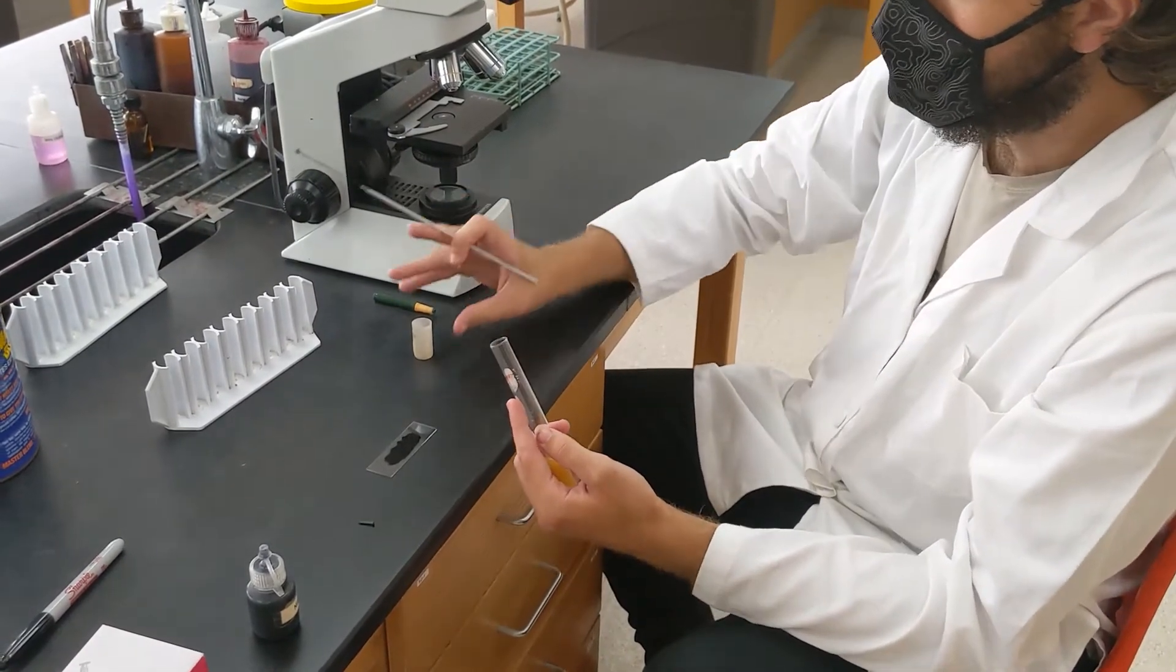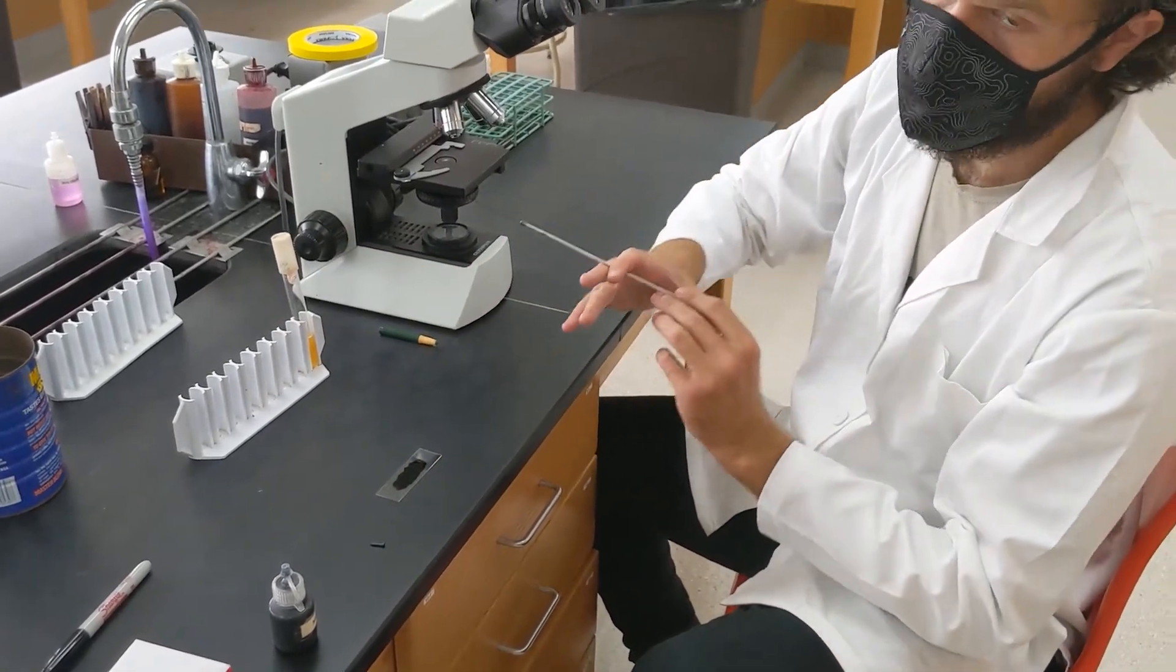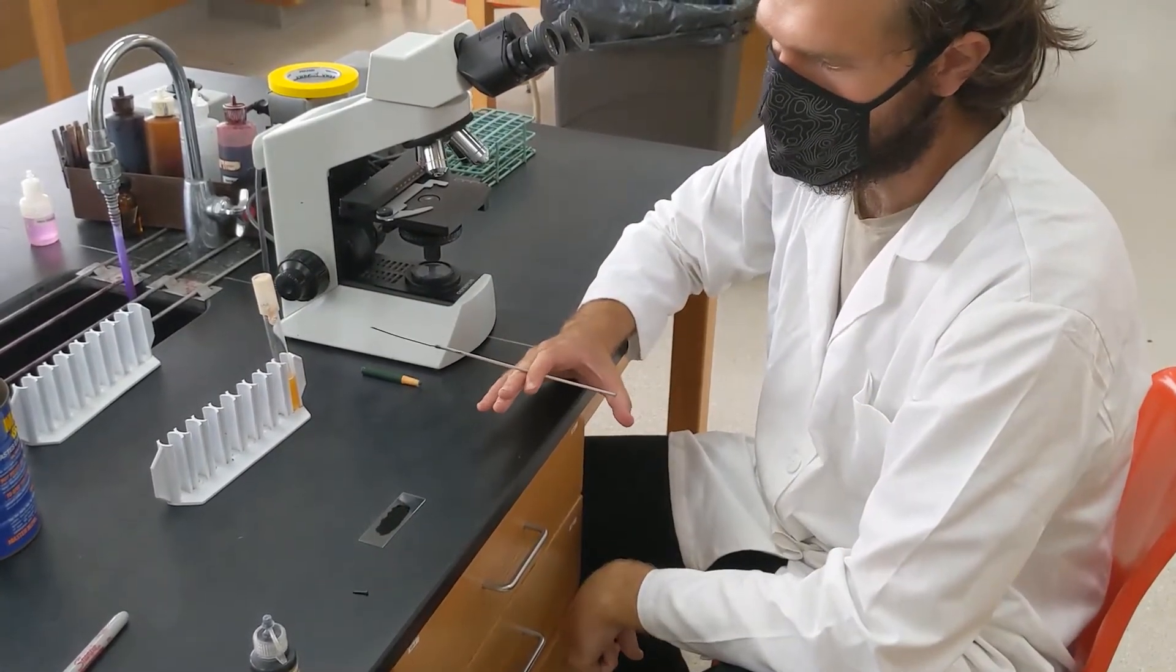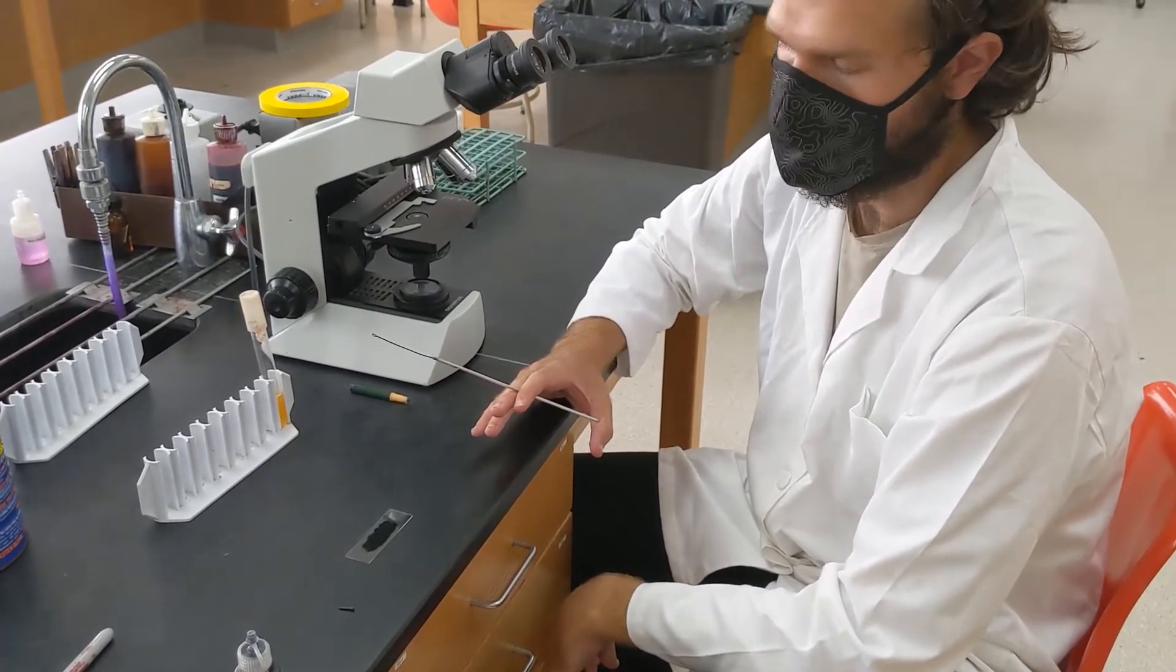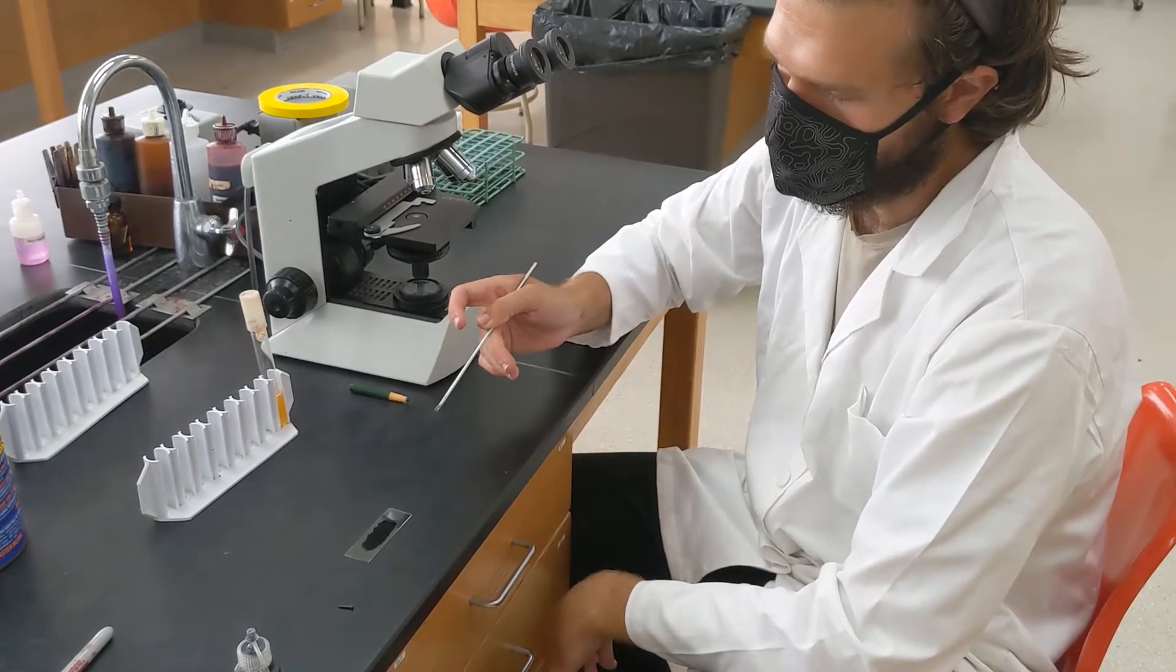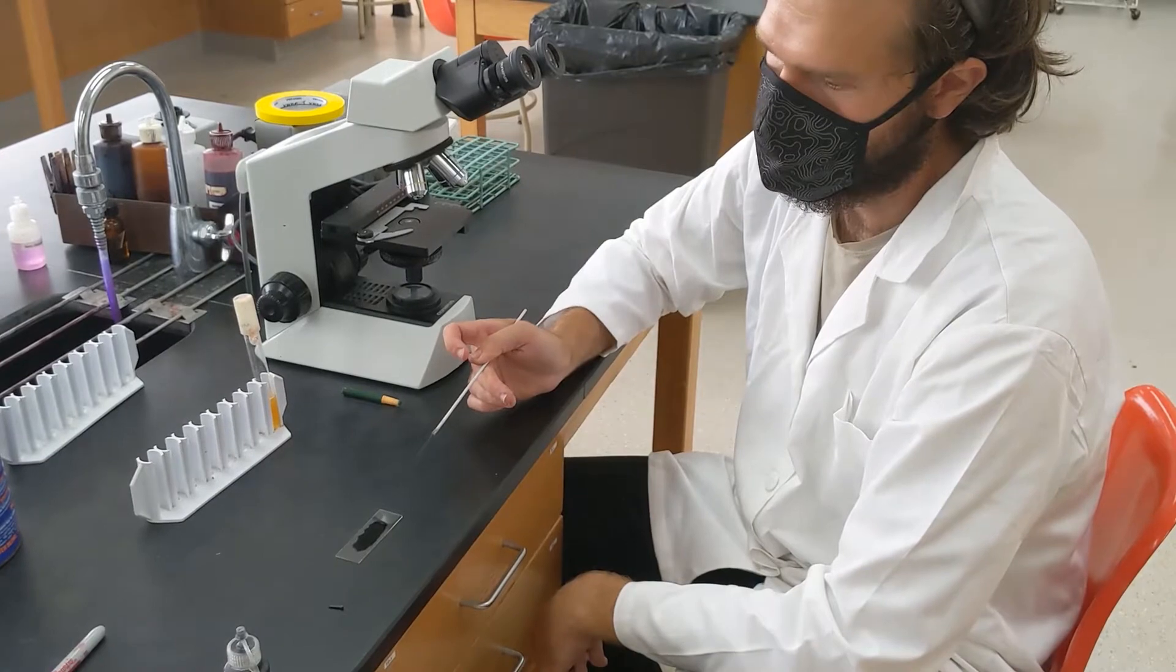A couple things regarding timing. If we were doing this experiment in person, first of all, I would recommend that you streak the plates first before doing the staining part of the experiment because it reduces the chances for contamination on the plates. Second of all, I would recommend starting with the indirect stain and then allowing it to air dry as you perform the direct stain.